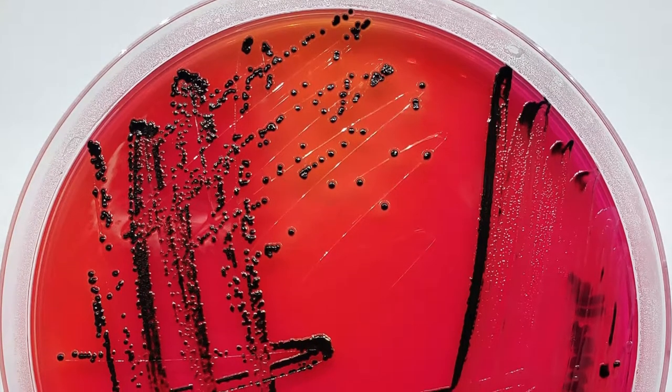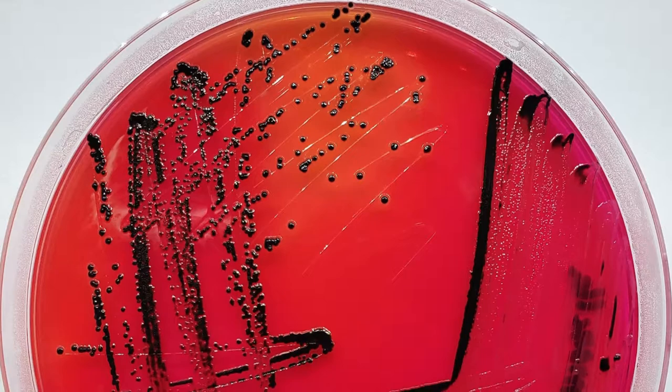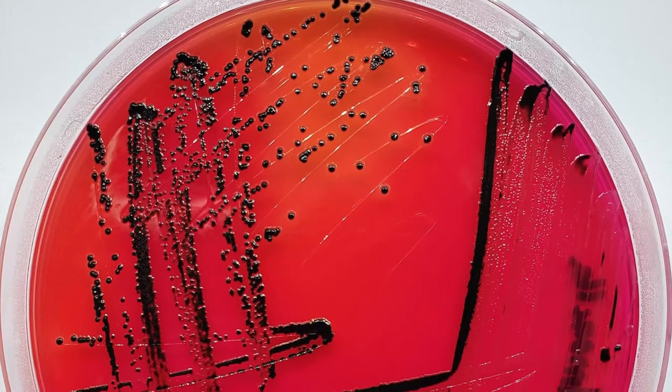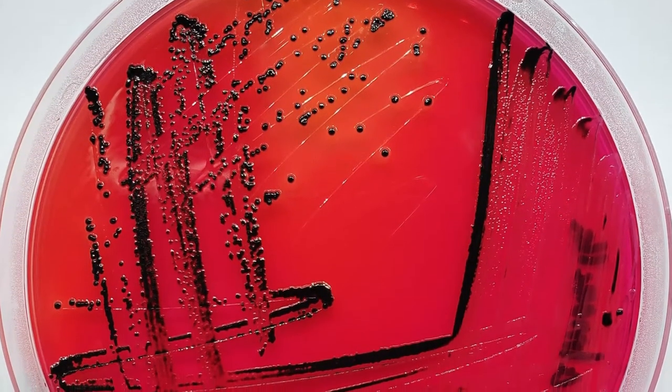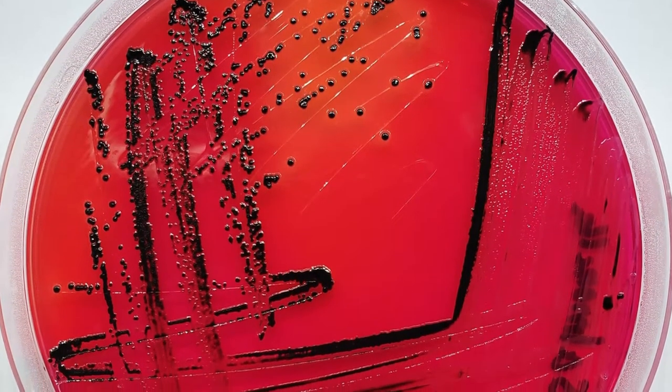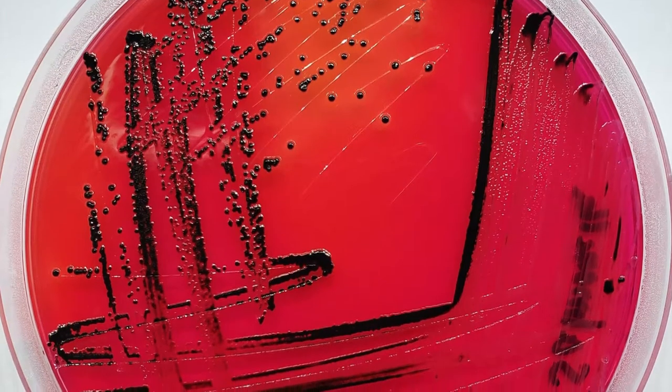Subculture is a key skill in the bacteriology laboratory, allowing us to clonally propagate a pure culture from a single colony. Pure cultures are essential for characterization, such as identification using biochemical tests or antimicrobial susceptibility testing.